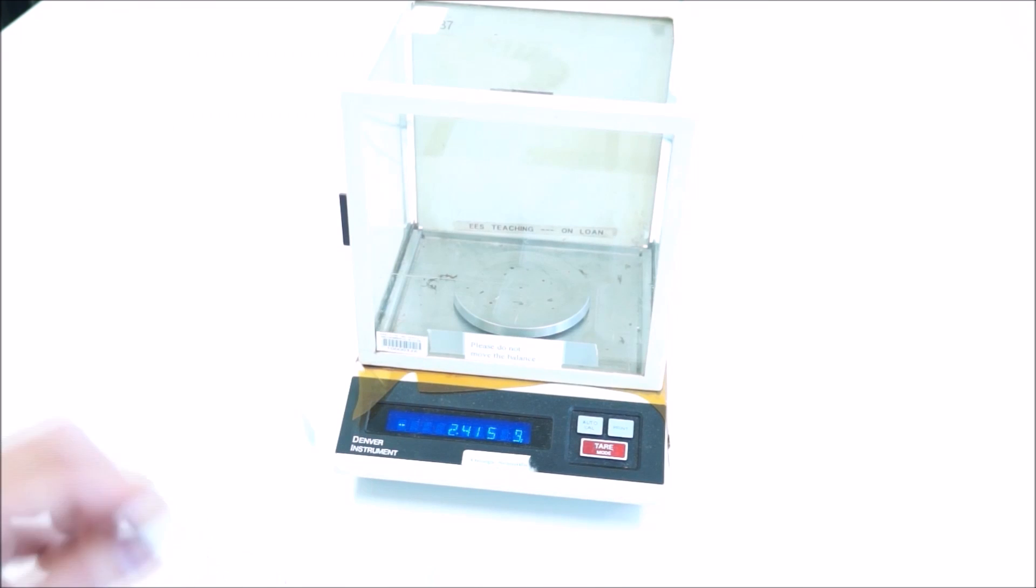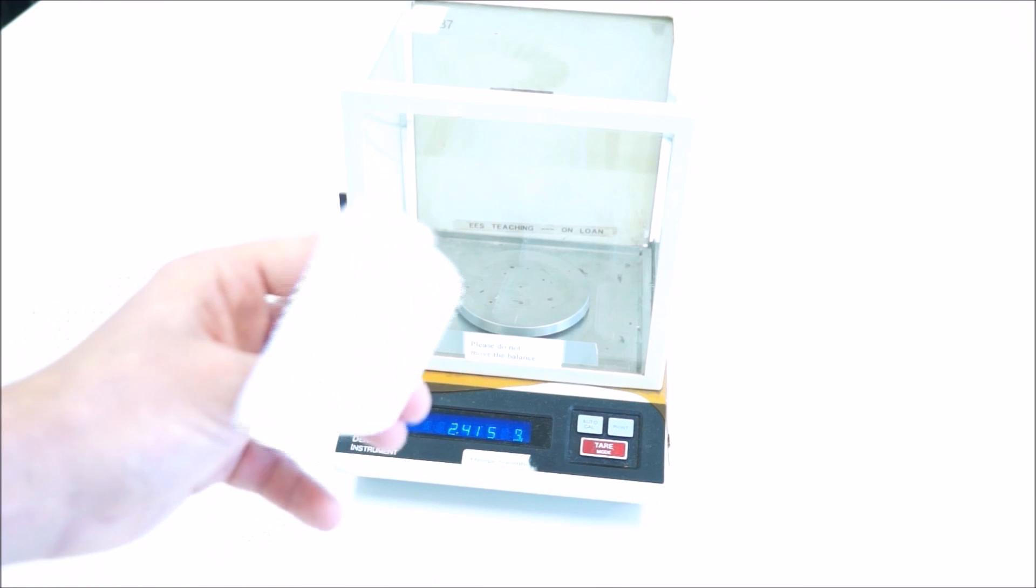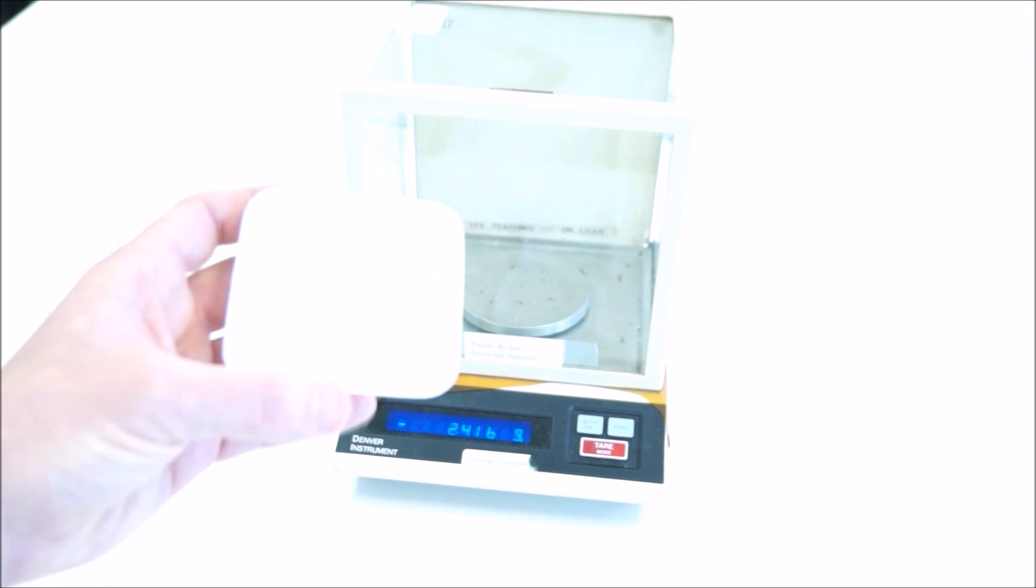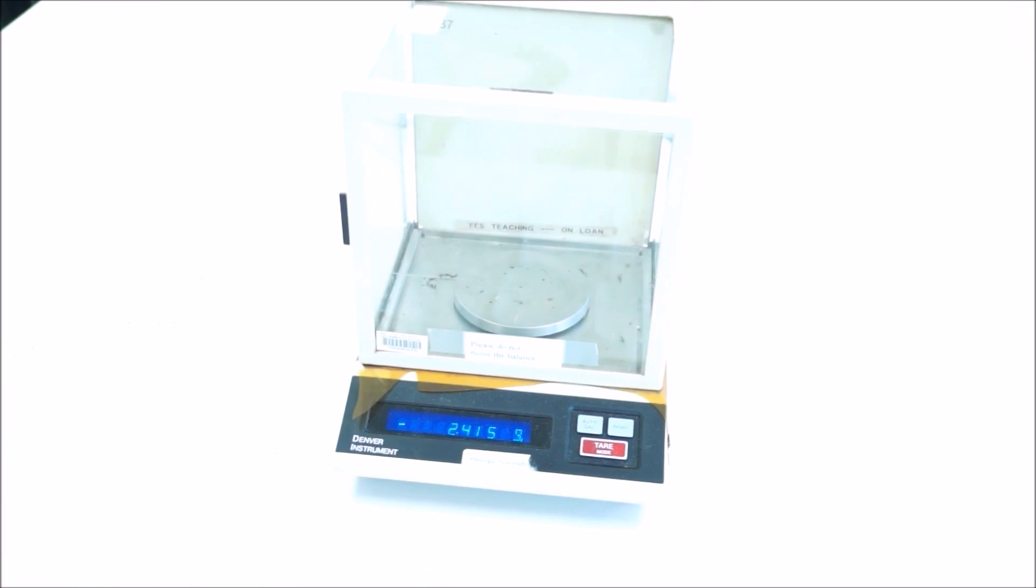The first thing you'll do is collect a set of these sample dishes. You need to collect your eucalyptus, moss, and lichen in these dishes. As a good scientist, you know that single experiments are very rarely adequate, so you should collect three dishes for each, so you have nine dishes in total.